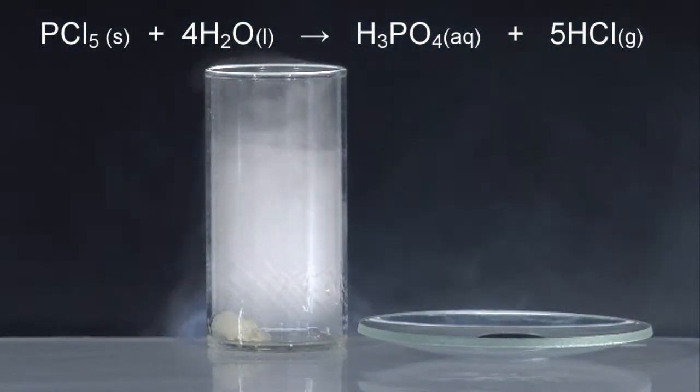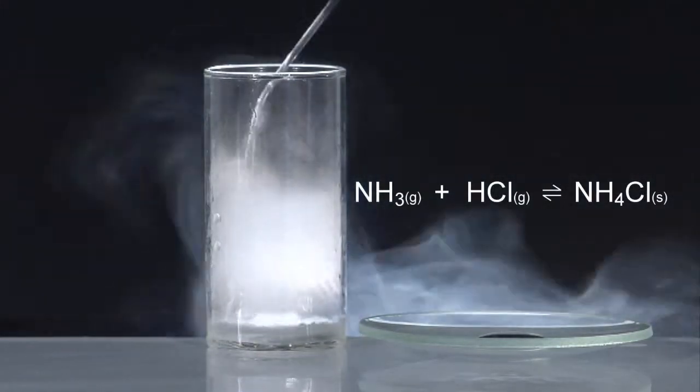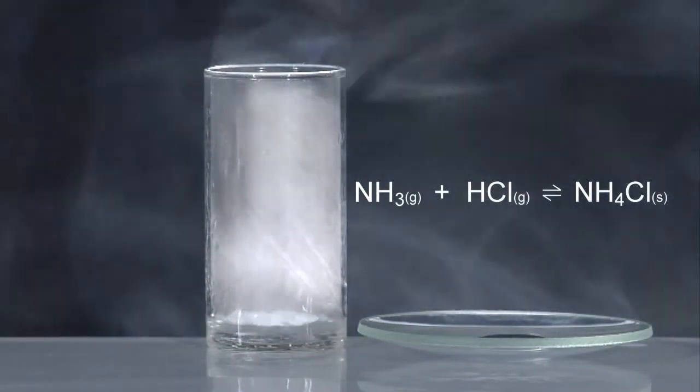The smoke formed is solid ammonium chloride. Ammonia gas is often used as a test for hydrogen chloride vapour.